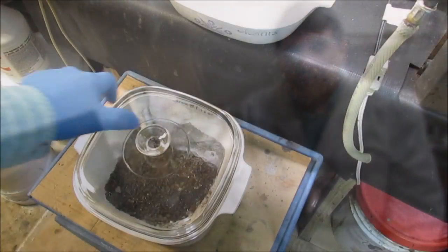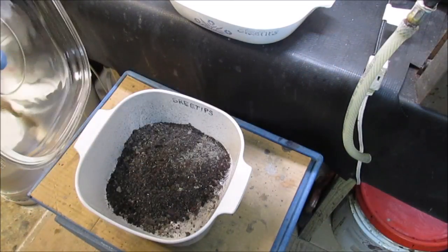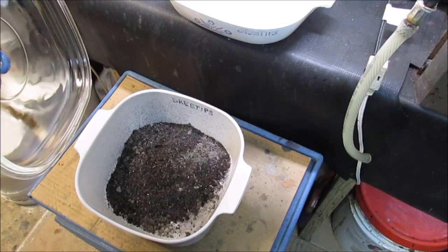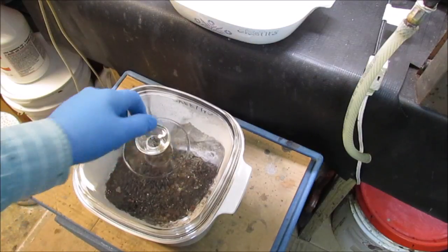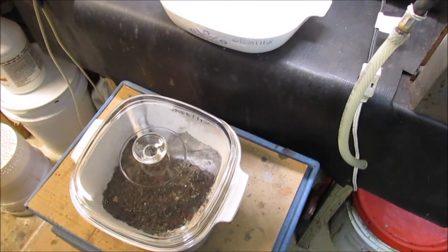And then we'll proceed from there. We're going to start doing that for you right now. Here's our ash. And what I need to do is run that through a strainer to get the big particles broken up and any foreign material sifted out.